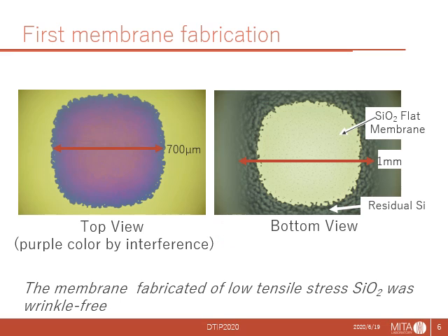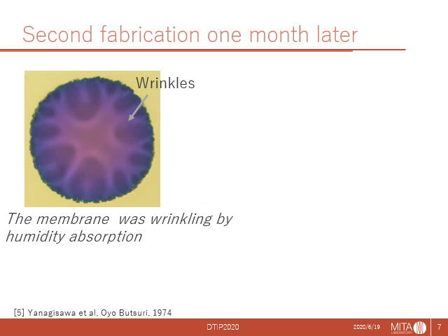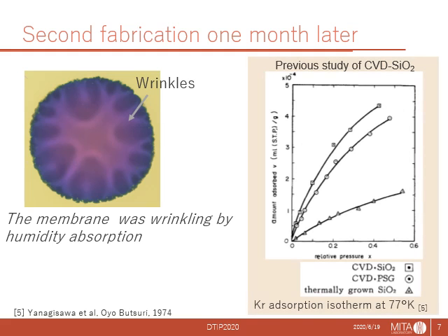But this might be a beginner's luck, because our second result was different. This membrane was fabricated one month later. It was wrinkling. The chip was obtained by the same method as the first trial. The wrinkling occurred regardless of finishing treatment, both the all-dry process and the wet last process. It means not only deep RIE, but also finishing with TMAH wet etching. Then we noticed from a research paper that CVD silicon dioxide does absorb humidity and thereby elongates the membrane.